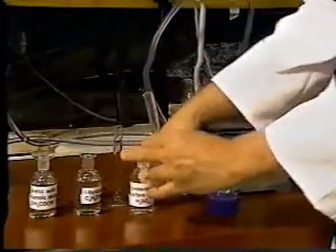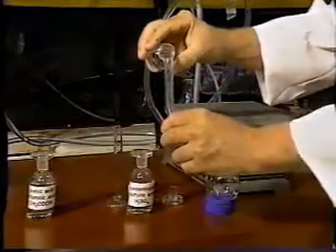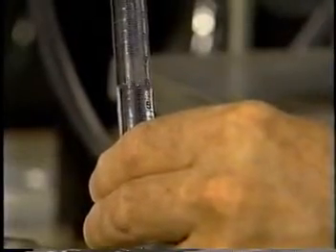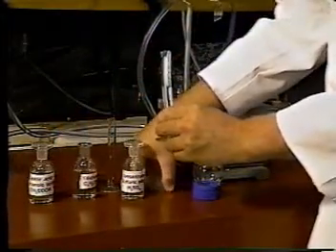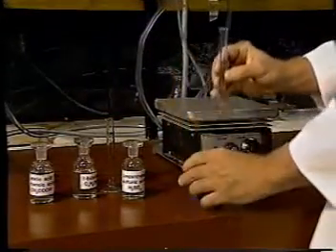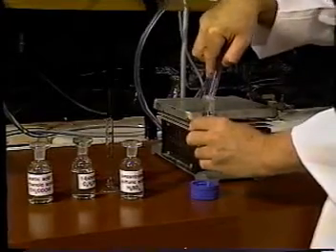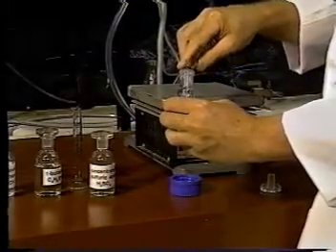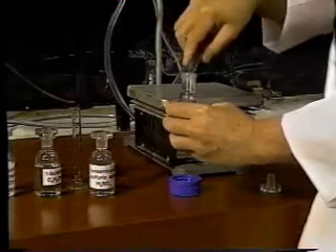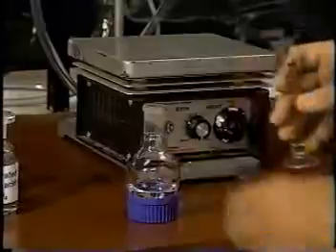To begin, we measure out 7.5 milliliters of butanol and pour it into the flask. Then we add 9 milliliters of ethanoic acid. Concentrated sulfuric acid is our catalyst — we add 1 milliliter.